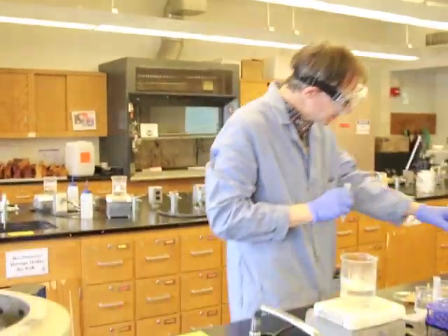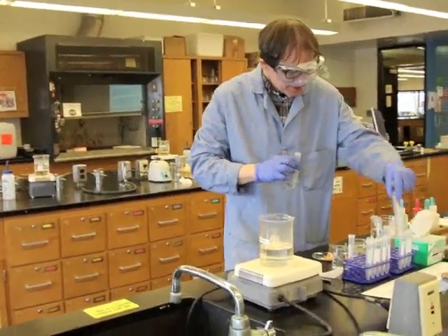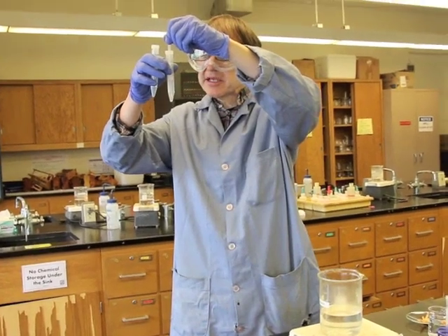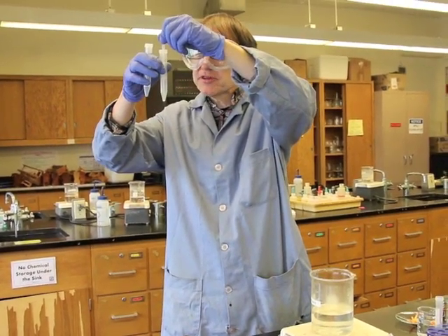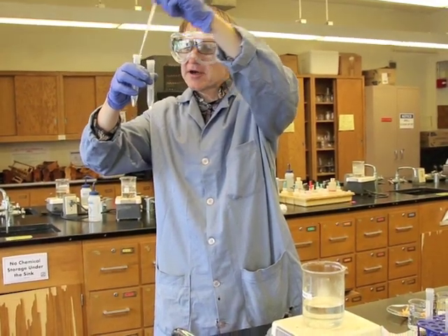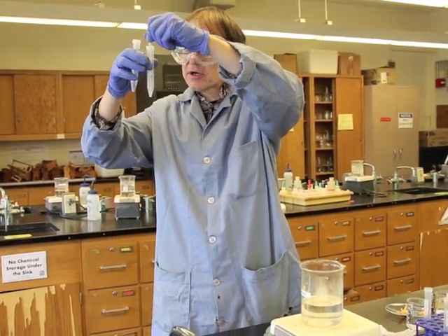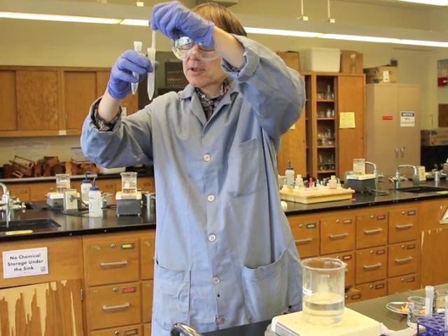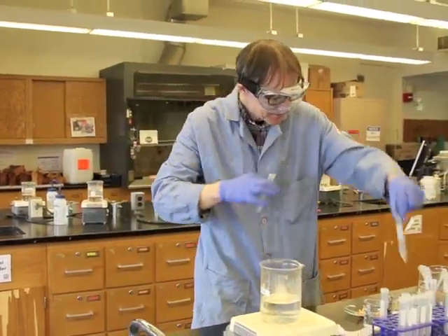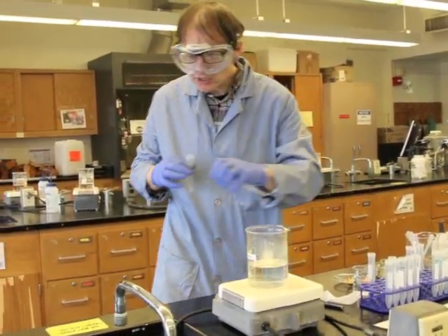So what I'm going to do, just to be on the careful side, is come over here and transfer some of that supernatant over into here, making sure that I don't get the solid with it. I just want the supernatant. So there's our supernatant there. Maybe a little bit more. We'll put that over here. There's our supernatant. We're going to use that in the next part.